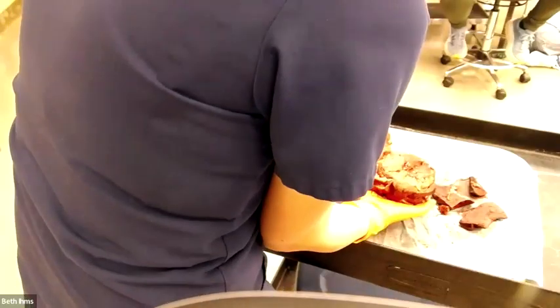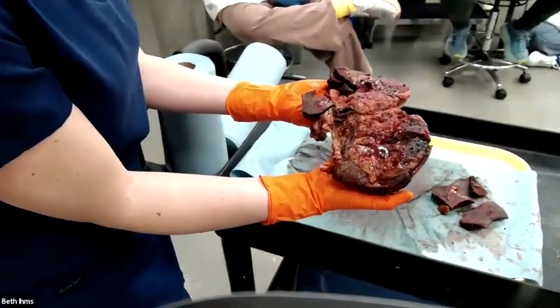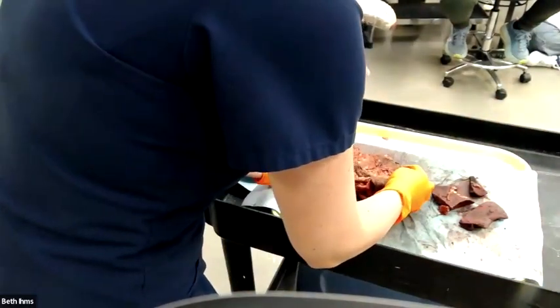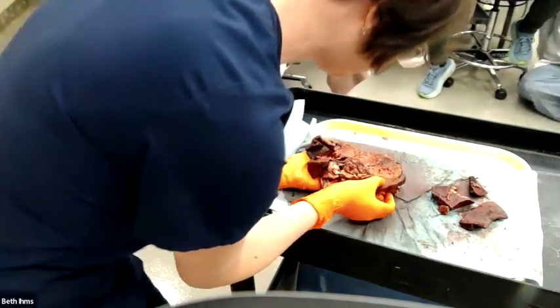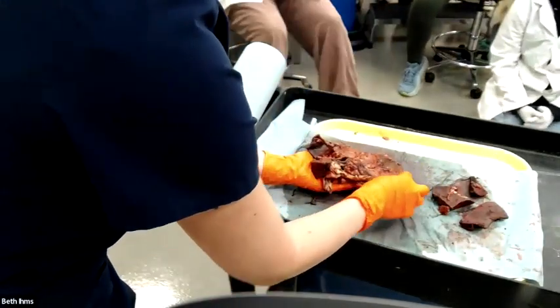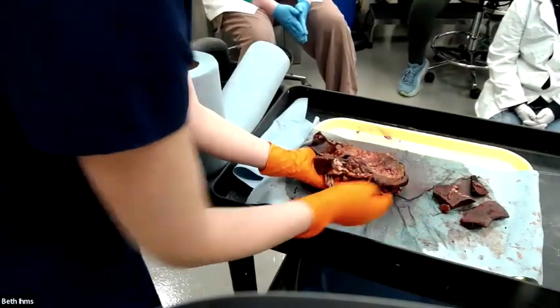Uncut section, ew, right? What do you think about demarcation for this? I think I would accept either answer because look, come closer. Over here, it's pretty well demarcated. I can draw a line around where it starts and stops. I'm even pretty sure if I get really close that I can see a little connective tissue capsule around part of it. So it's partially encapsulated. That would be my descriptor.